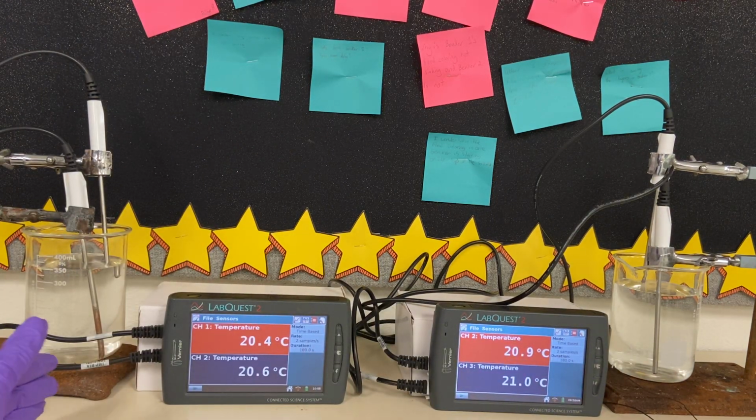On the left-hand side, this is beaker 1, and on the right-hand side, this is beaker 2 from the original blue ice progression. What I have in here is a setup with 2 temperature probes in each beaker. One of the temperature probes is at the bottom, and one is at the top. Now, it's up to you to decide what's the purpose of having 2 temperature probes and why we are measuring temperature in 2 different places.